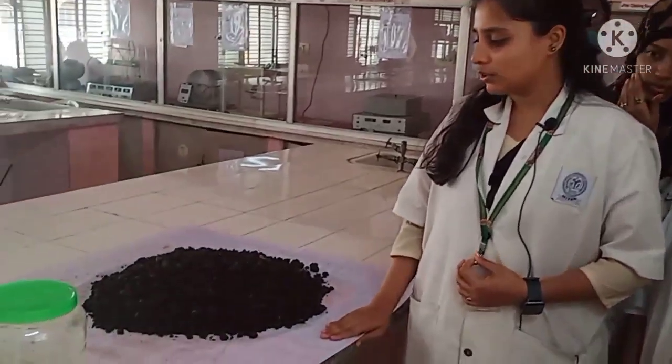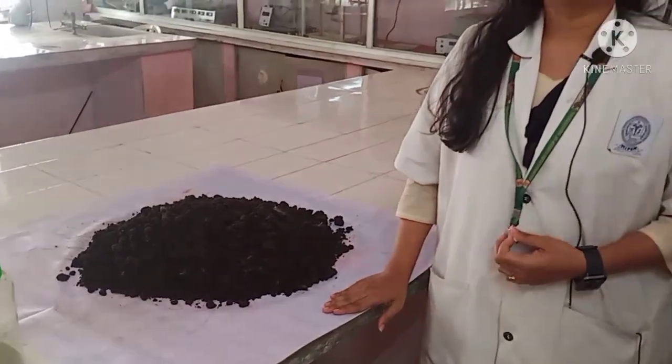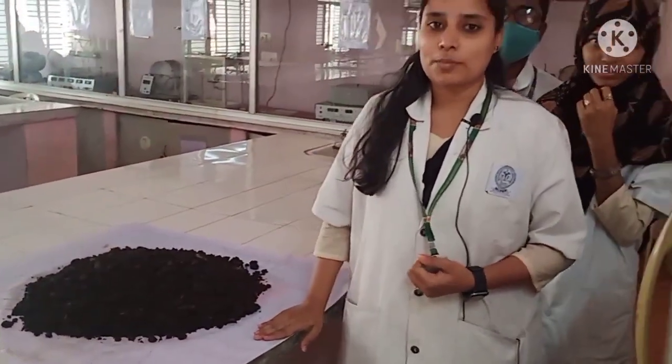Today we are going to perform an experiment on anti-helminthic activity. Helminthic infection is the most common infection present in the world at present. It has caused many diseases in developing countries such as anemia, malnutrition, and if these infections migrate to other organs they may cause lung infections, liver infections, and other infections. Anti-helminthic agents are those agents which either kill or subside the activity of helminthic infection in the GIT.